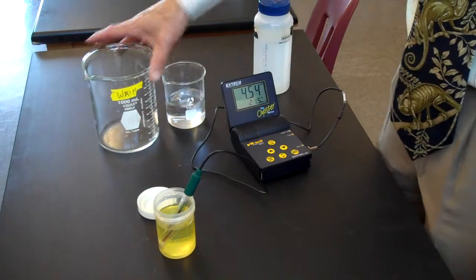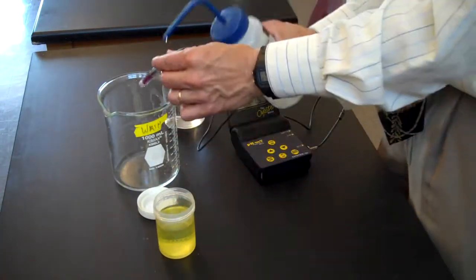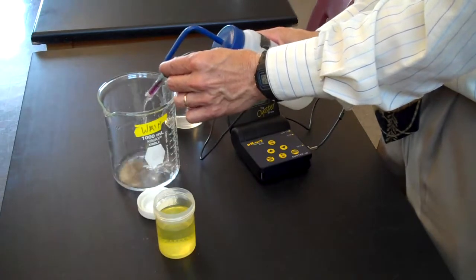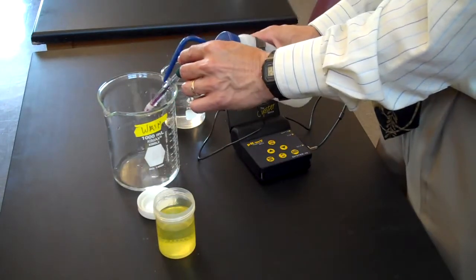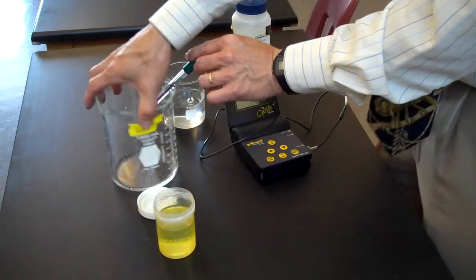You will need to rinse the electrode before you place it in your solution. So this is distilled water. I'm rinsing the electrode into a wash beaker.